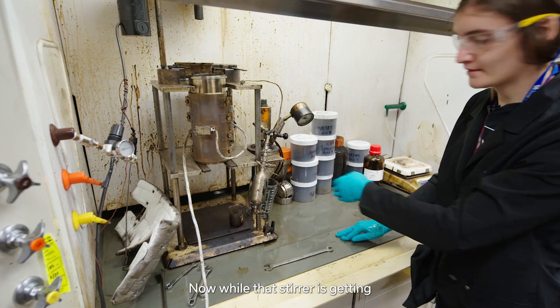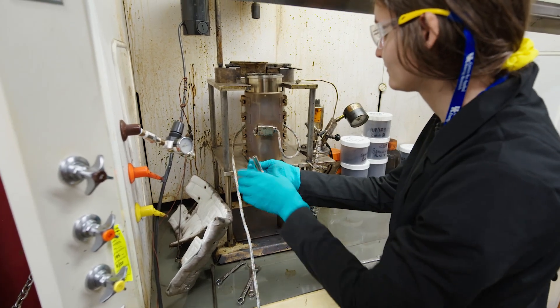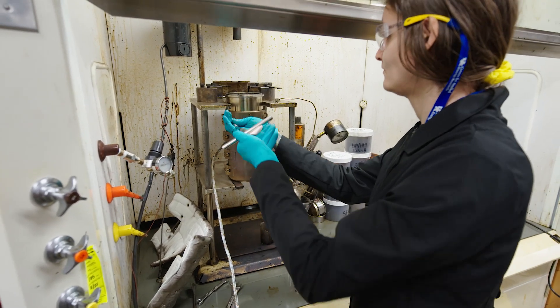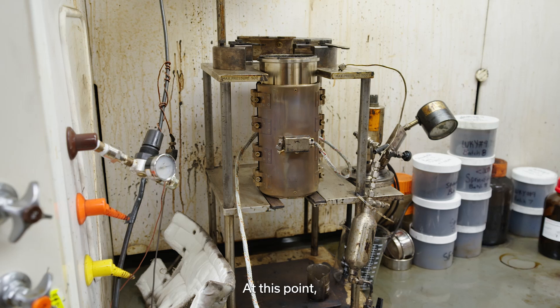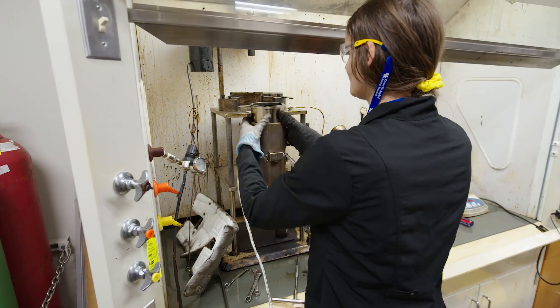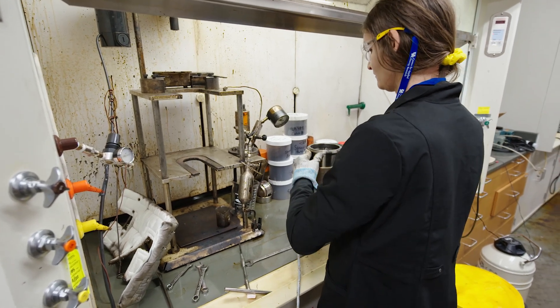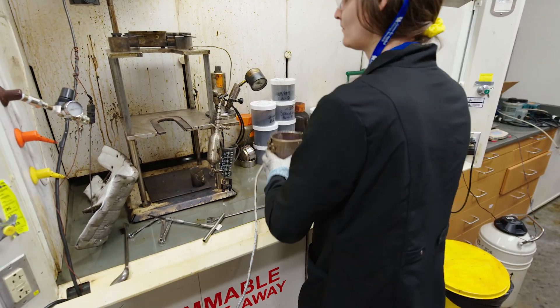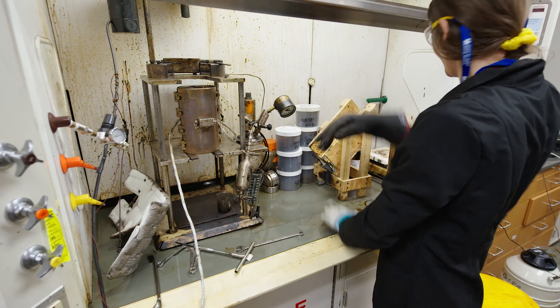While the stirrer is getting nice and clean, we're going to remove our heating jacket. At this point, we'll need heat gloves. Now we get out our custom-built wooden frame to empty this out.